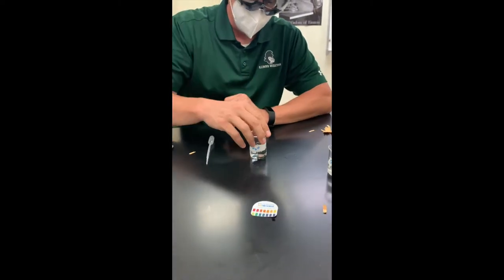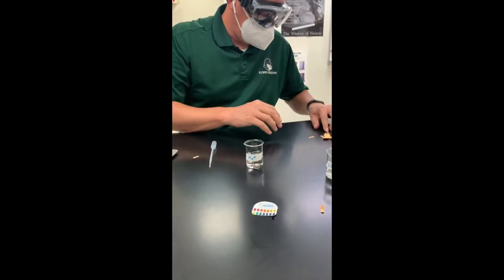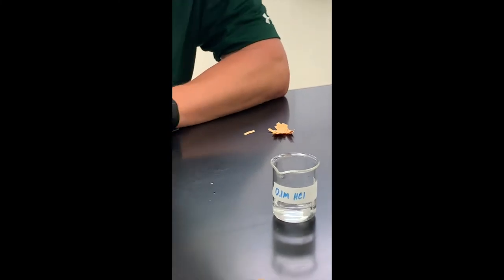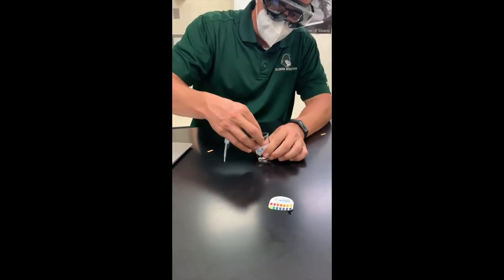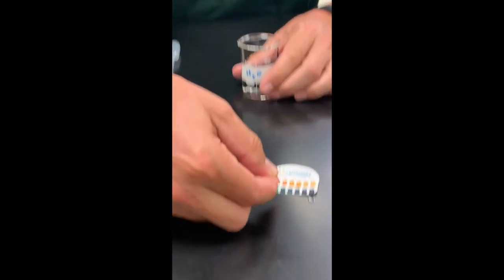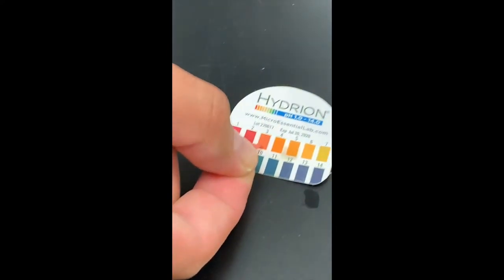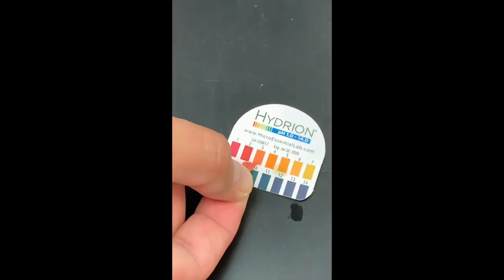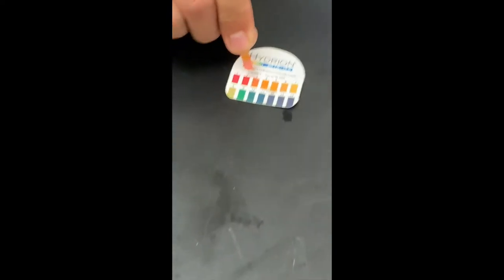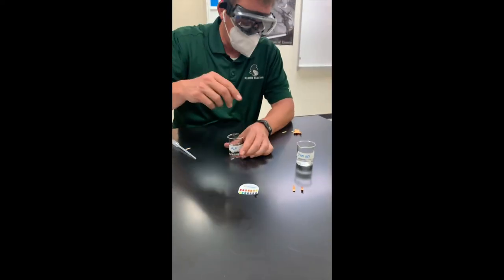There's our first milliliter — I'm going to take the pH. And that seems to be sitting between a two and a three. That was our first milliliter.